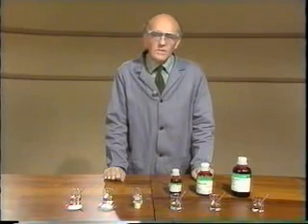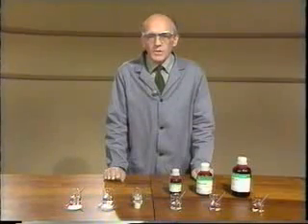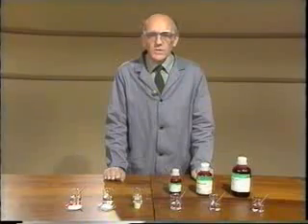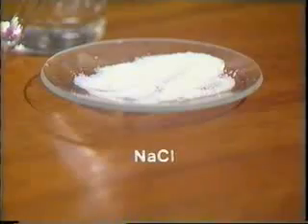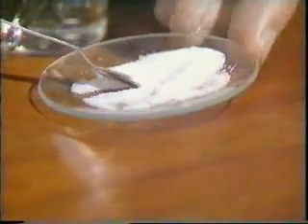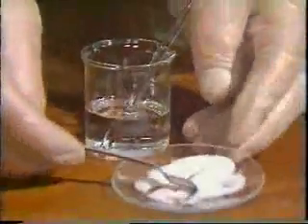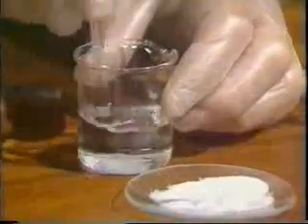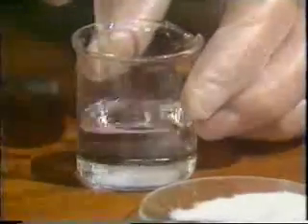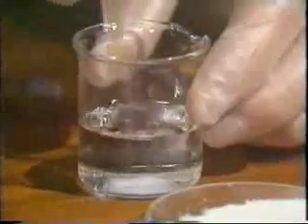Now you know that sodium chloride is ionic, and that's why it dissolves in water. But what about a non-polar solvent such as hexane? If I add some sodium chloride to hexane and stir, there's no sign of the solid dissolving at all.